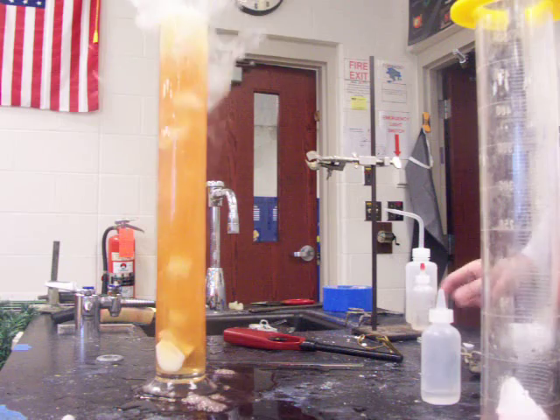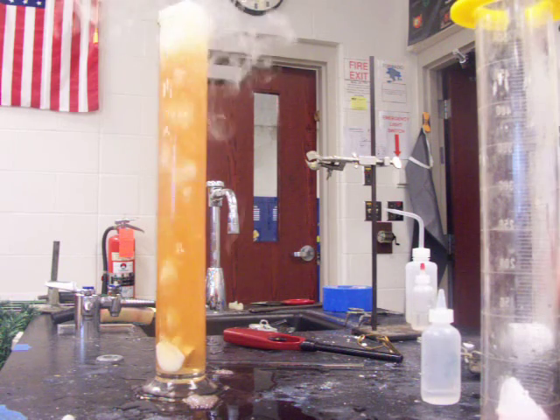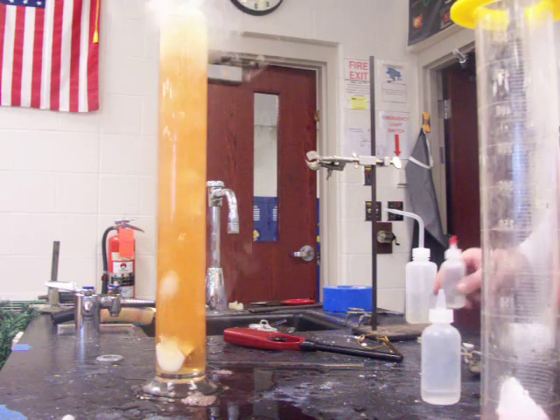This is that orange! No — that's that orange! That reminds me of the mango fish. That's what you're dealing with.